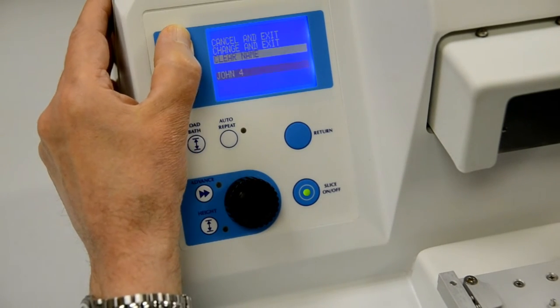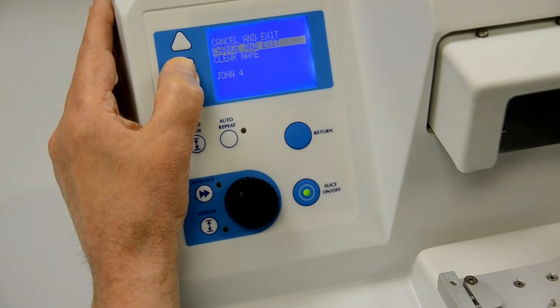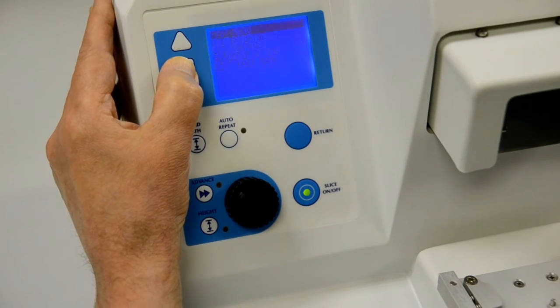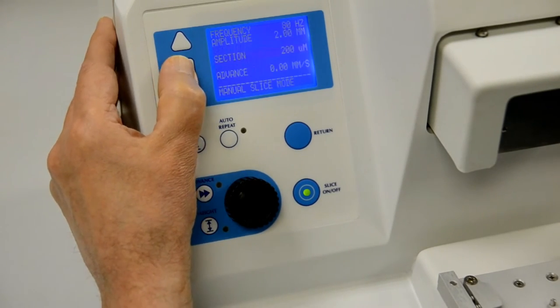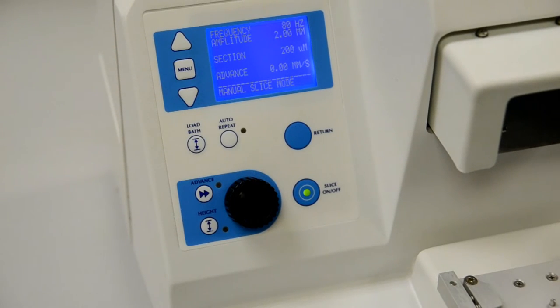When you have finished, select the line change and exit and press the menu key. Any changes that you now make to the operating parameters will be remembered under this user name.